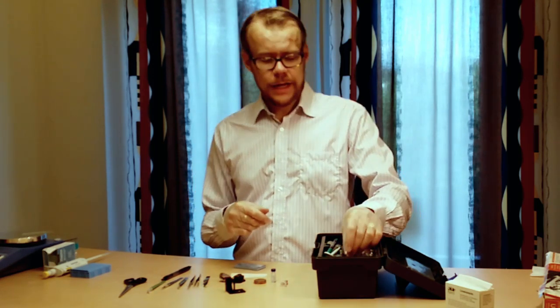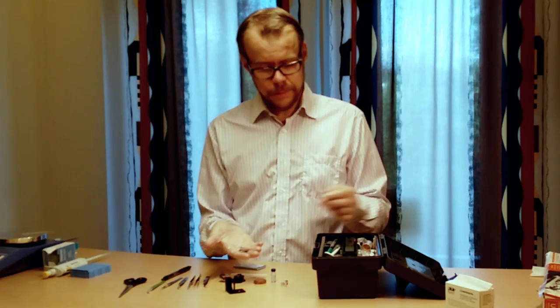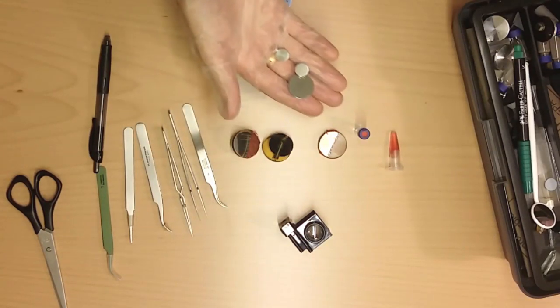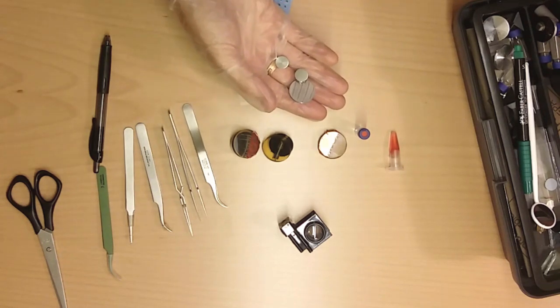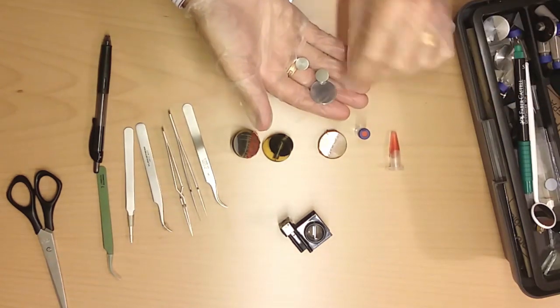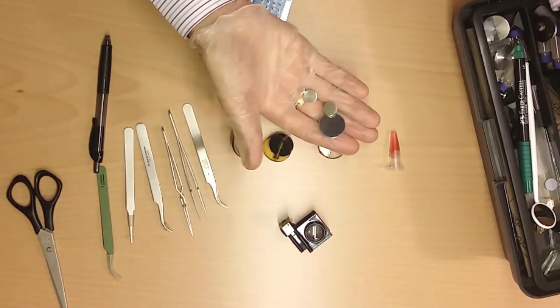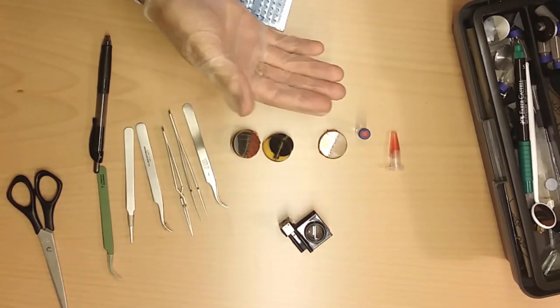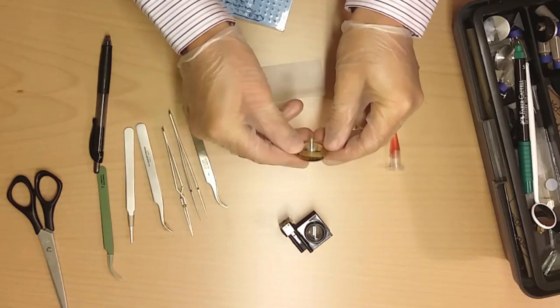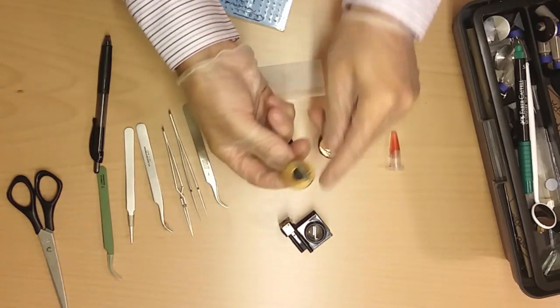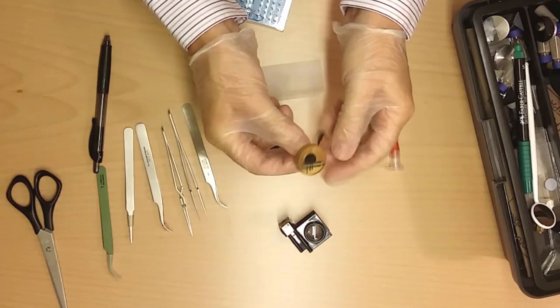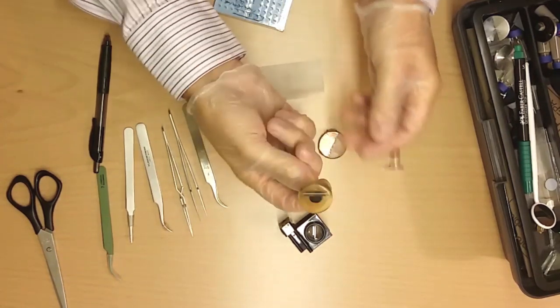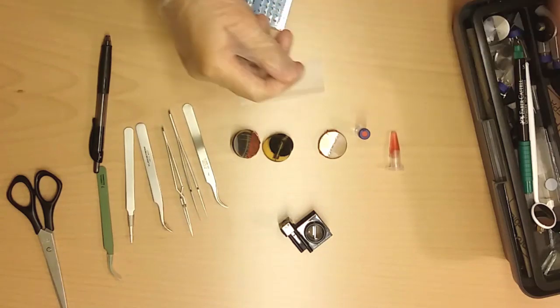I also have lots of tool pieces for the microscope. This is for the SEM where you glue your samples on top. To do that you need to have some carbon tape. Here I have some carbon tape. When you have done the whole package it will look like this. So here you have an embedded plastic piece with paper substrate that has been attached to this piece that can fit inside the SEM.